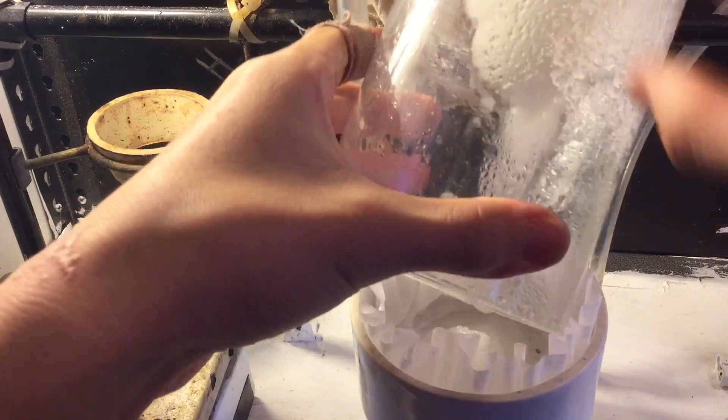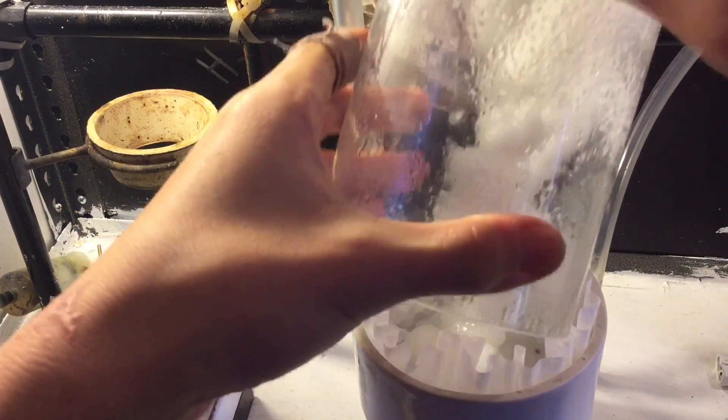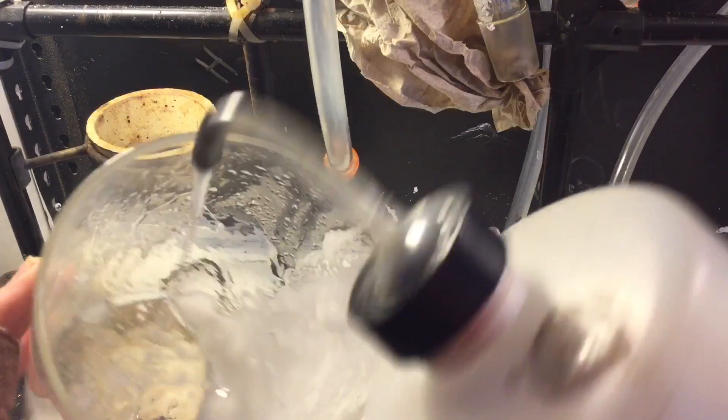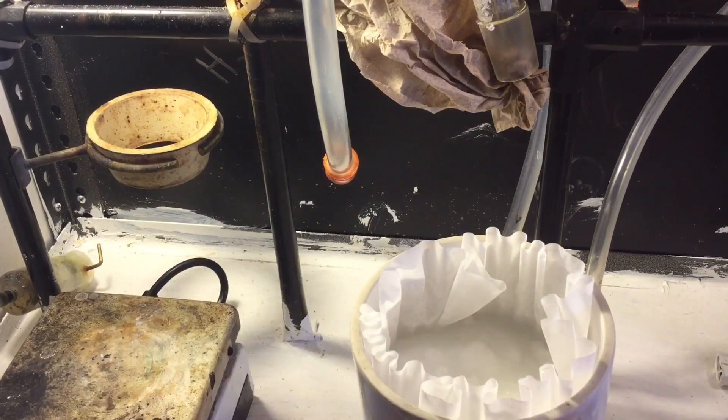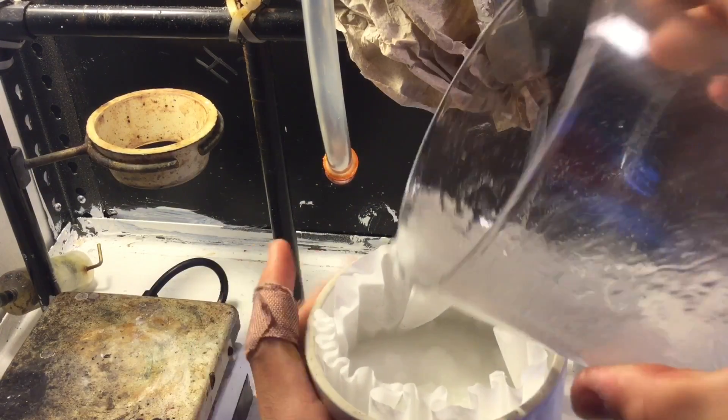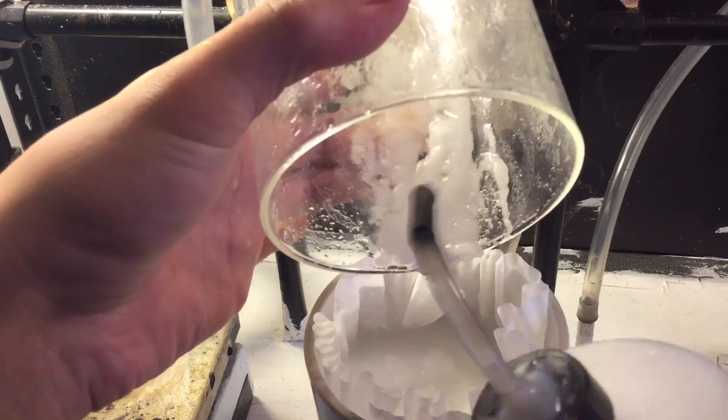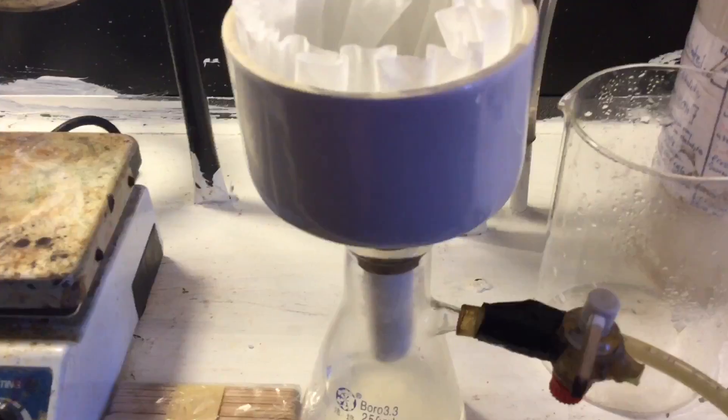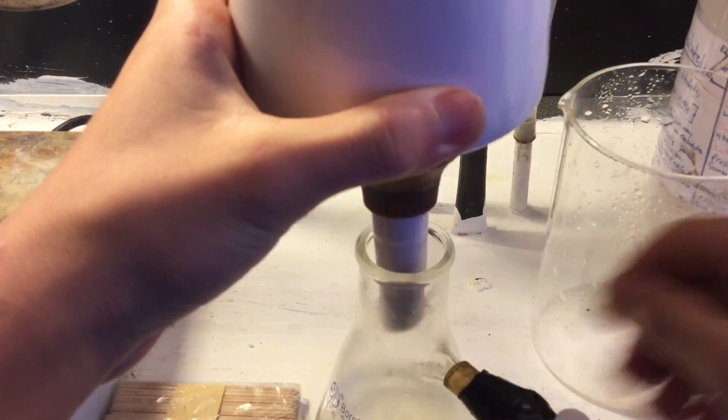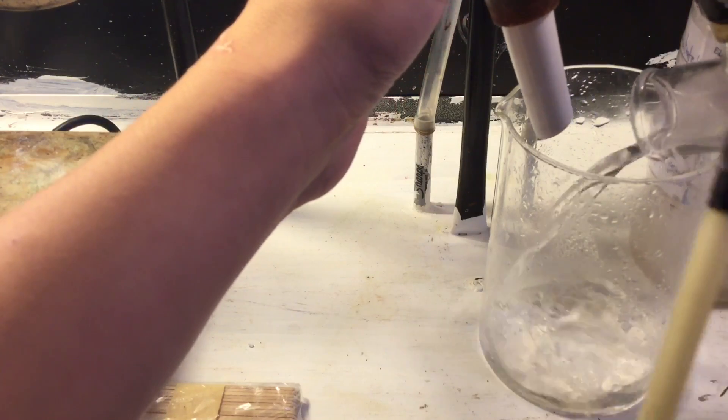Got really quite a decent amount, but this way it does also get more contaminated with any NaCl and any H2SO4 or sodium sulfate, whatever that is. Just wash it a tiny bit, that's to remove any HCl, because you don't really want HCl in your product, at least not if you're gonna do the next step.